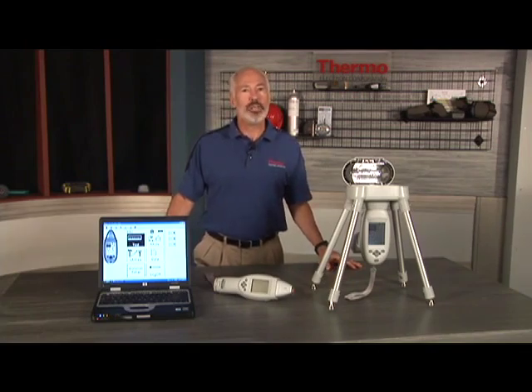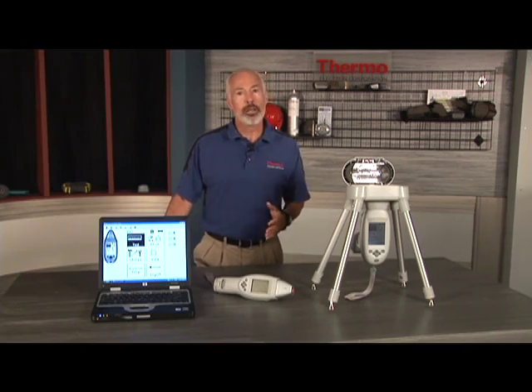If you do have unique needs that are not covered by this module, please refer to the user's guide or contact your local Niton Analyzers sales representative for assistance.